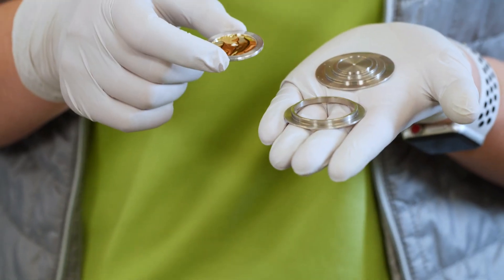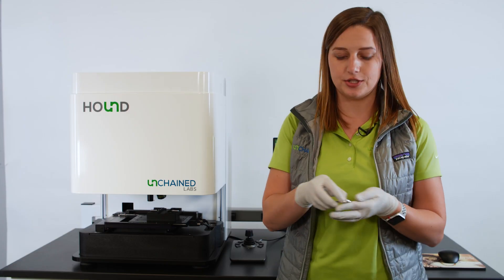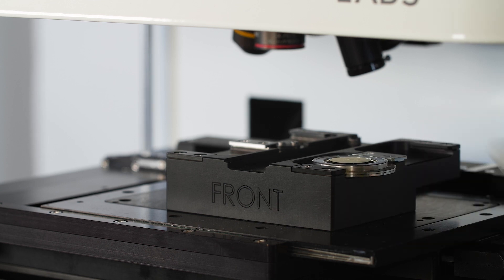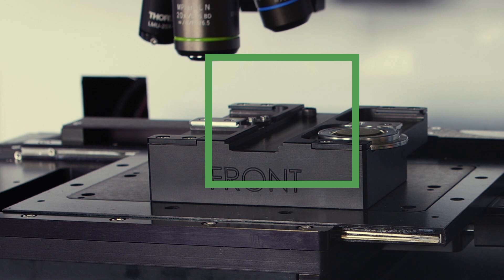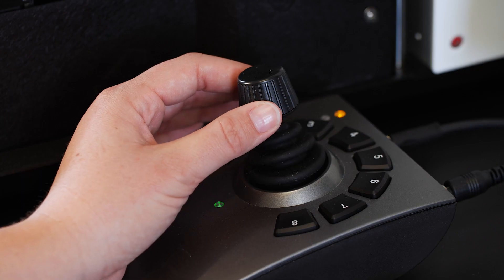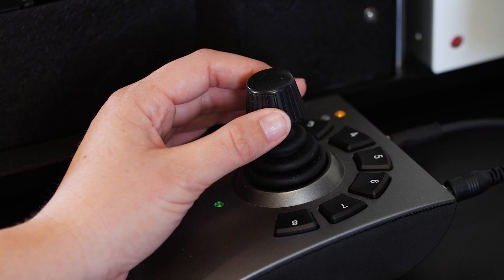I place a filter round into the sample mount, then I slide it into the stage. Hound can hold up to four filter rounds or a standard microscope slide. I'll use the joystick to move it under the microscope, navigate, and adjust focus.